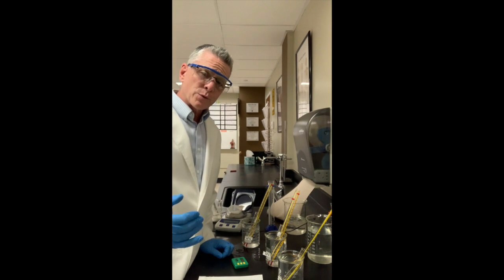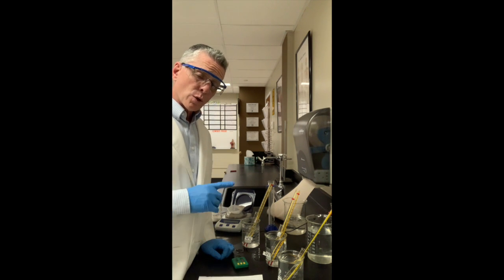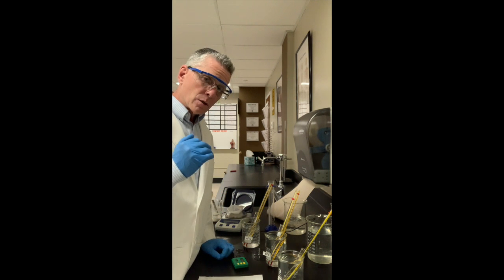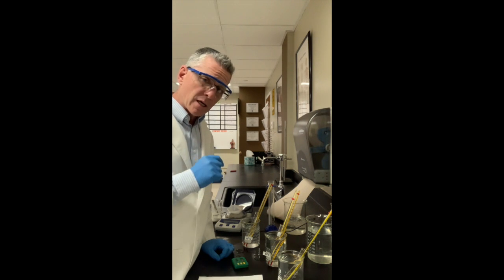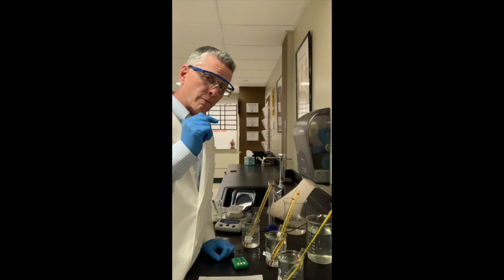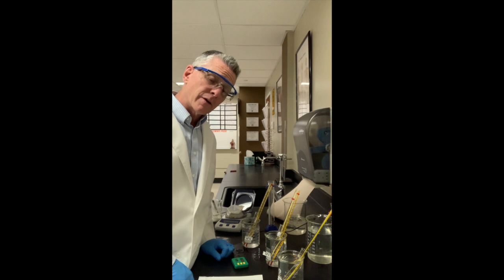So I've now finished recording the temperature. I've gotten 3 temperatures at the same amount, which was 44 degrees. So like we saw in the other test tubes and beakers, the temperature of the faux anus, the body temperature, changed and met the surrounding environment's temperature at equilibrium every time. In this case, 37 degrees went up to 44 degrees, and the 50 degrees came down to 44 degrees. Interesting. And it did it very quickly.